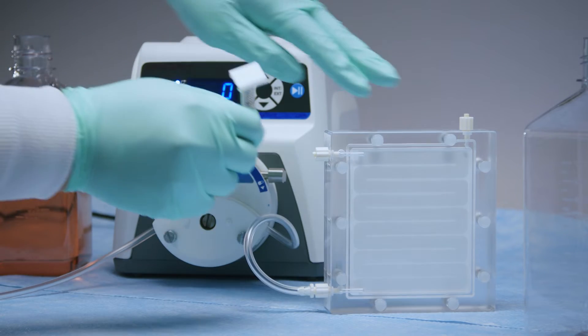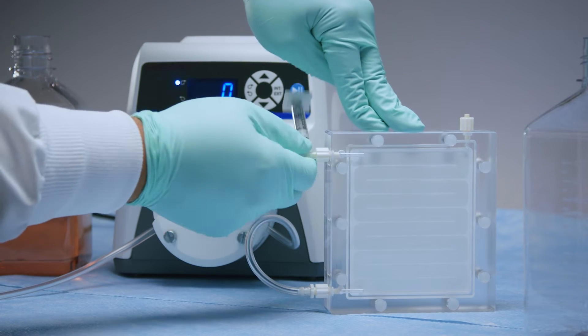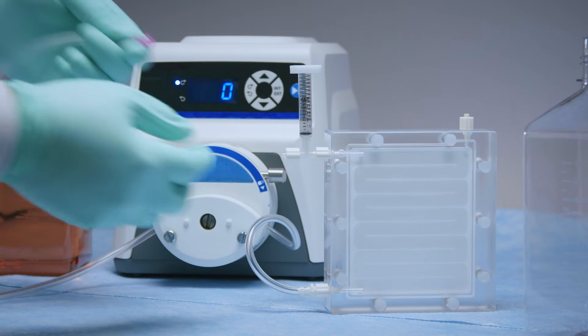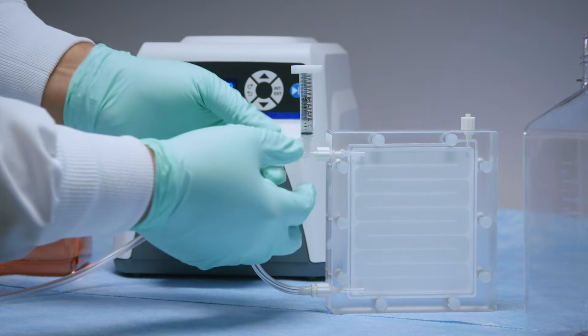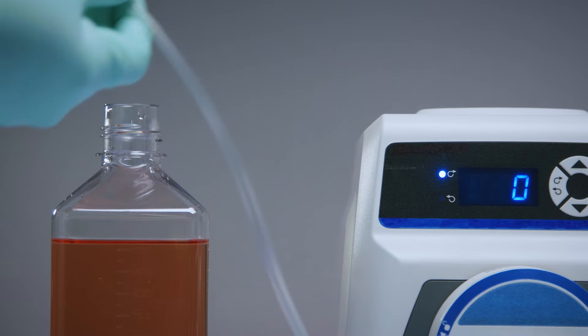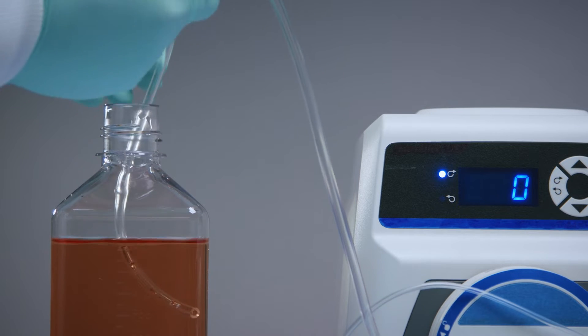Next, connect the return line and pressure gauge. Then, place both the feed and return lines into the sample reservoir.